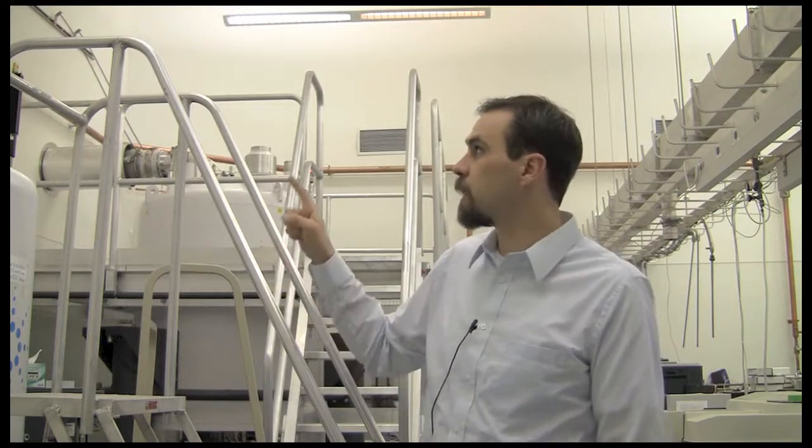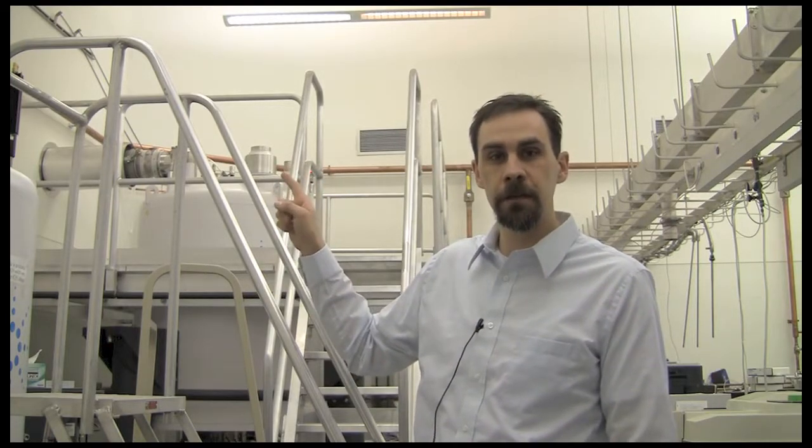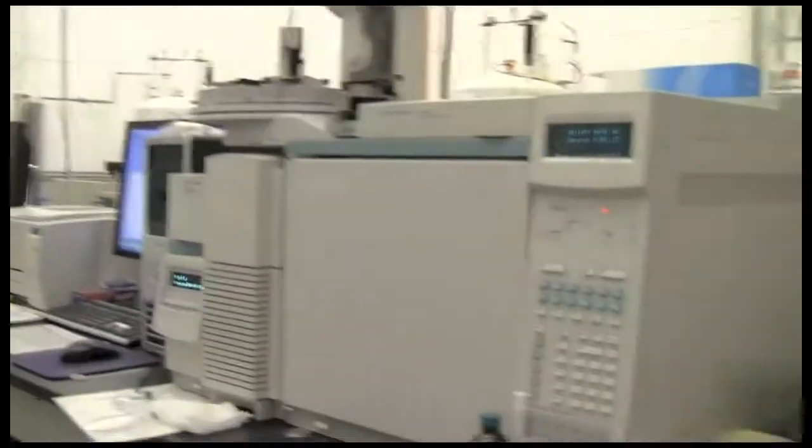Once you've loaded your sample in the sample changer carousel, make sure to remember the number of the location you loaded it in, and then return to the console to set up your experiment.